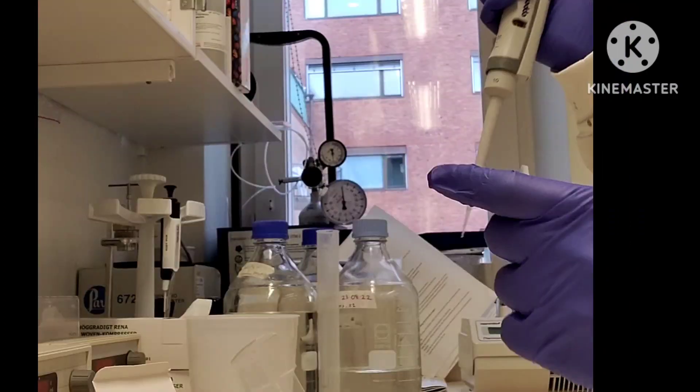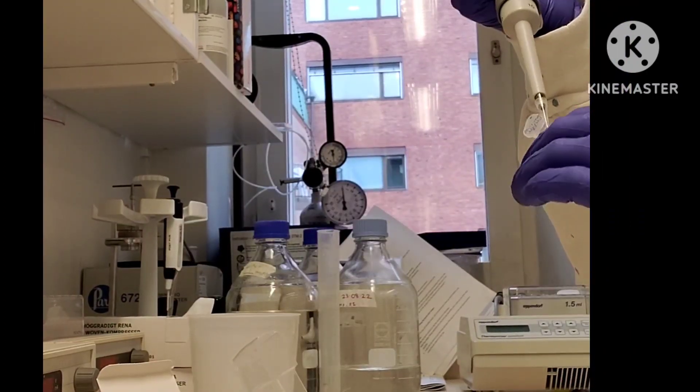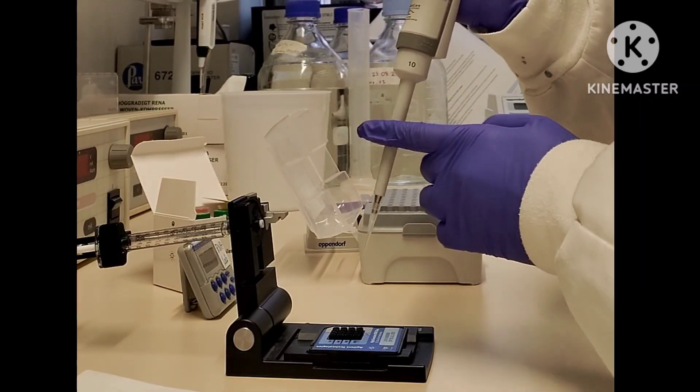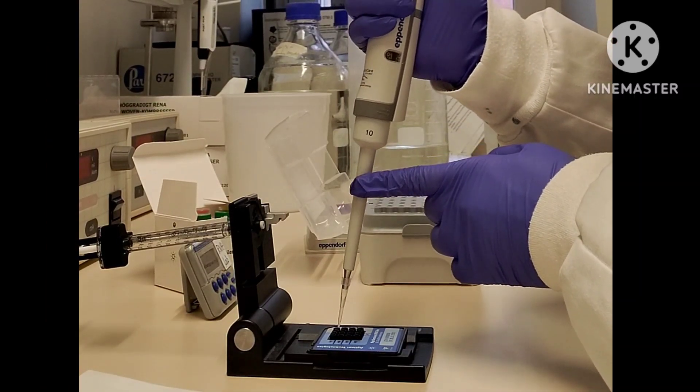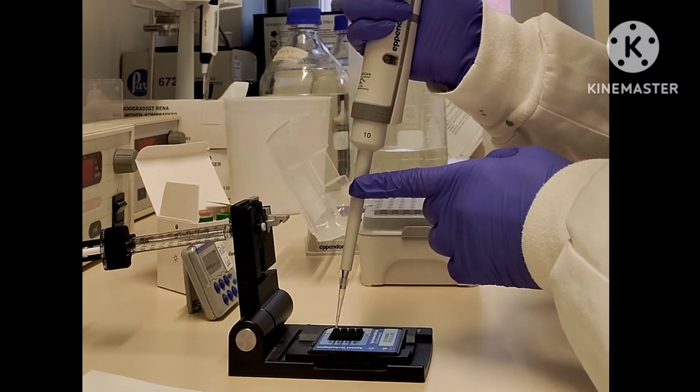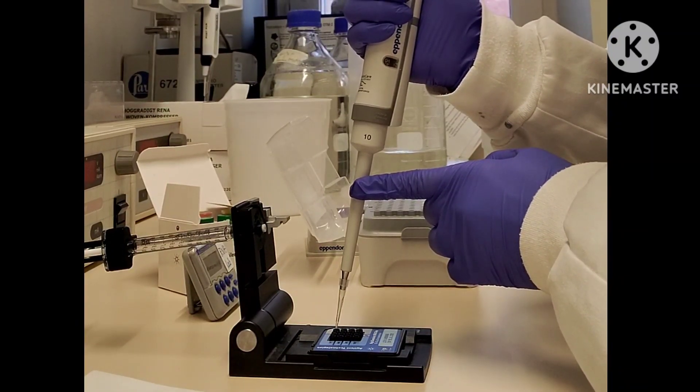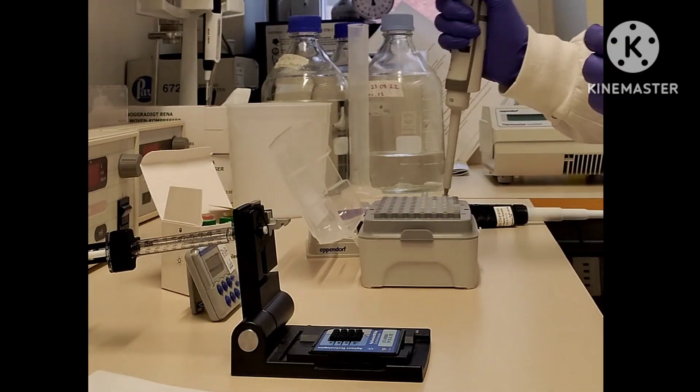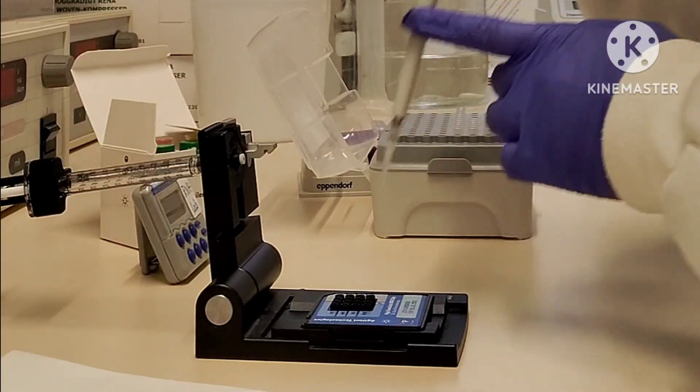Then add or pipette 9 microliters of dye mix in each well which are marked with G. Always remember to pipette the gel dye very slowly since it's highly viscous in nature, as it will reduce error from your experiment.